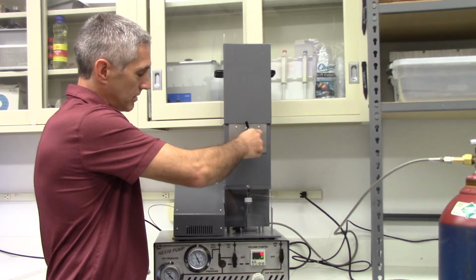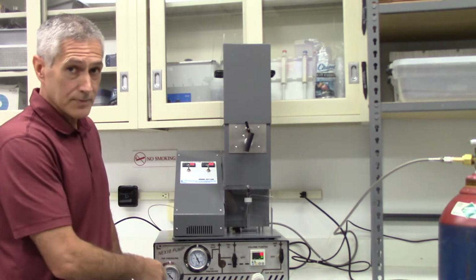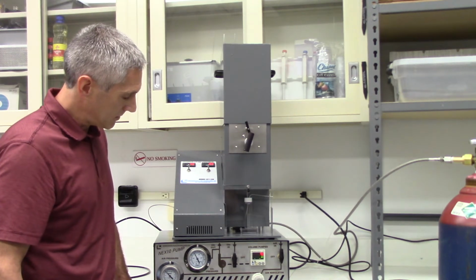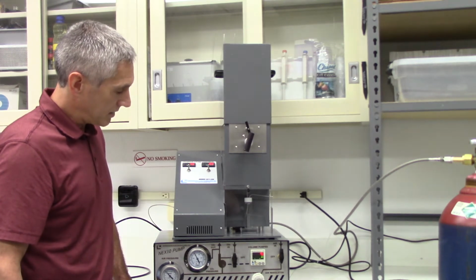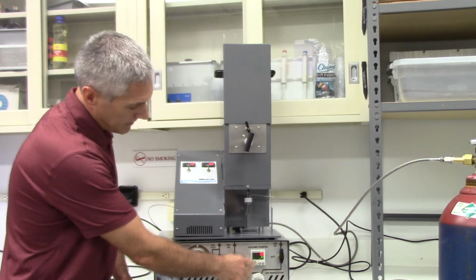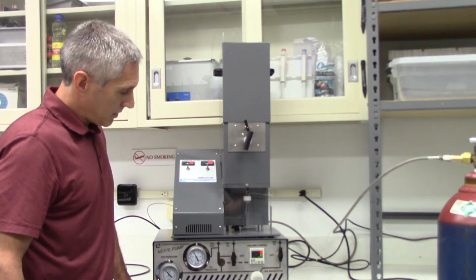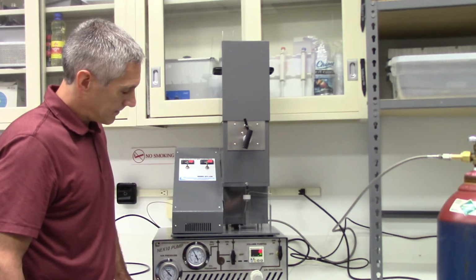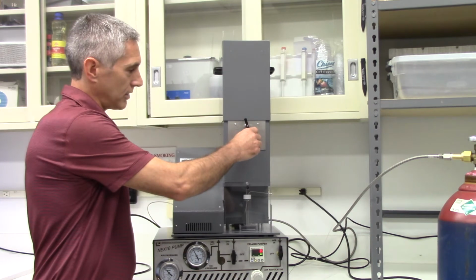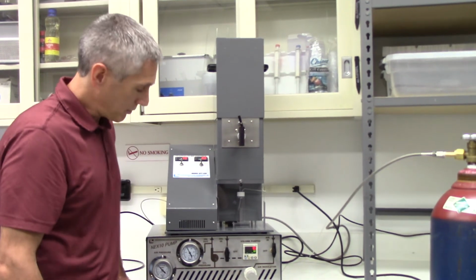As we start flowing CO2, you'll hear the CO2 pump start to actuate to maintain the pressure in the system. So currently, and when we start flow, we want to reset the counter. So we're going slowly right now. You can increase the flow a little bit. The pump strokes will increase to keep up the pressure.